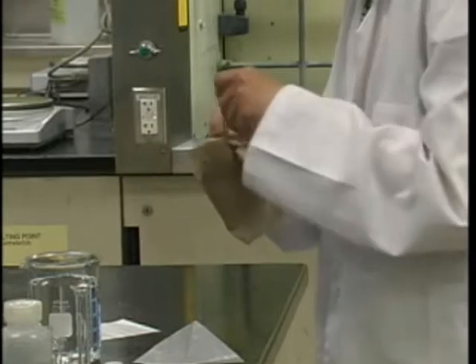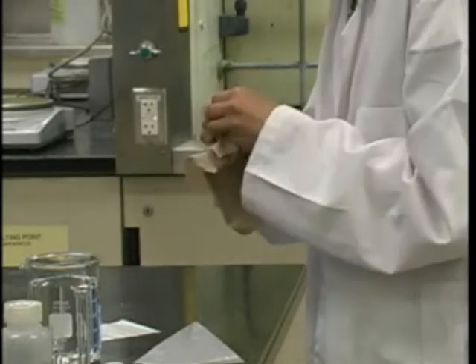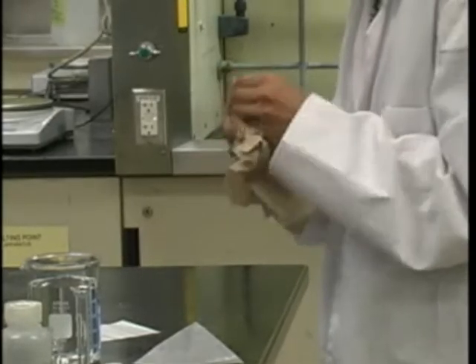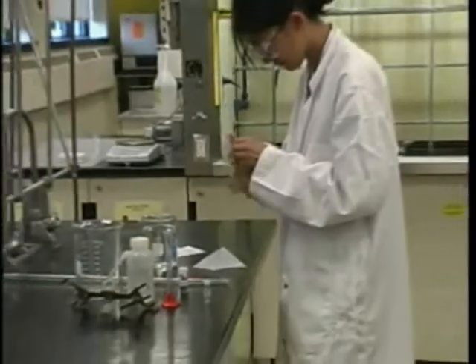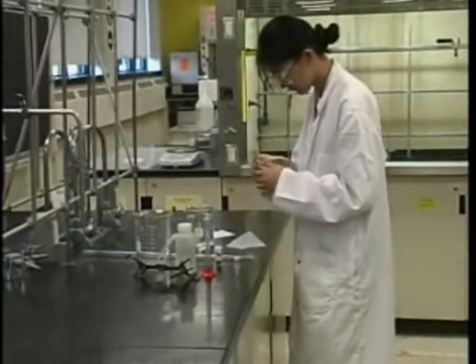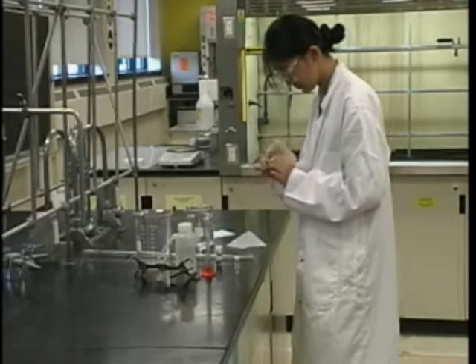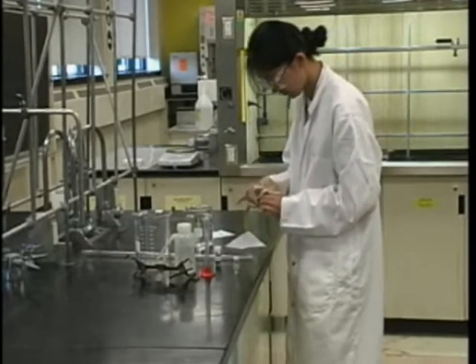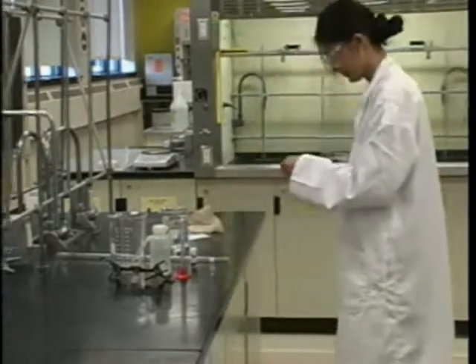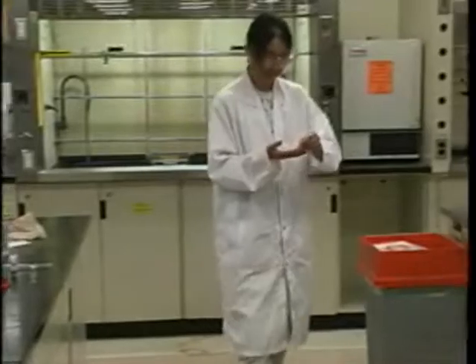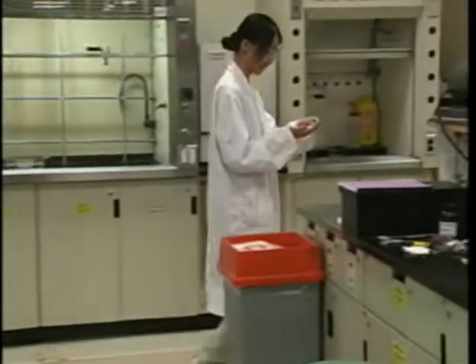Once you have cleaned the sample with sandpaper, gently use the brown paper to remove any traces of metal shavings that may remain on the metal sample and place it on the weighing paper. You may now proceed to the balance room to determine the exact mass of your metal sample.